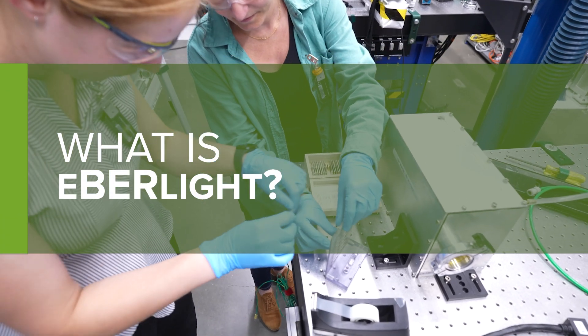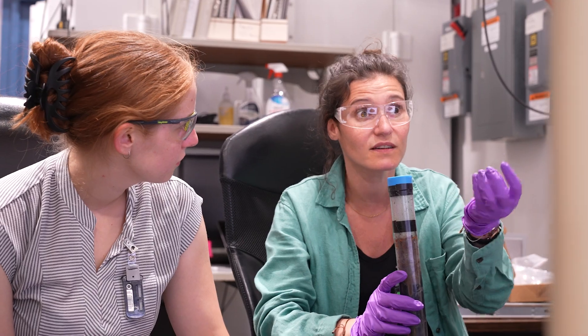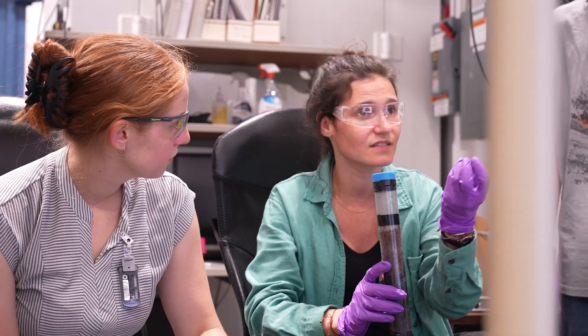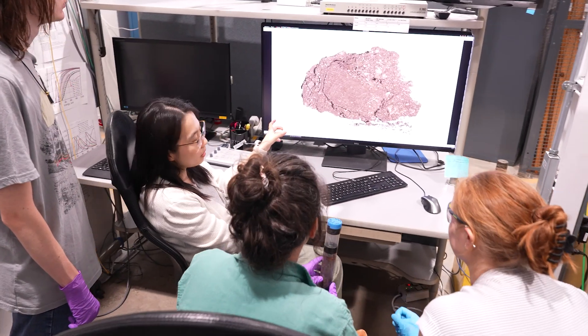Eberlight is a user program that operates at the Advanced Photon Source across several APS beamlines, offering access to state-of-the-art instrumentation for macromolecular crystallography, full-field imaging, X-ray fluorescence microscopy, ptychography, X-ray absorption spectroscopy, and scattering techniques. These methods allow probing both the chemistry and structure of complex and highly heterogeneous bioenvironmental systems.